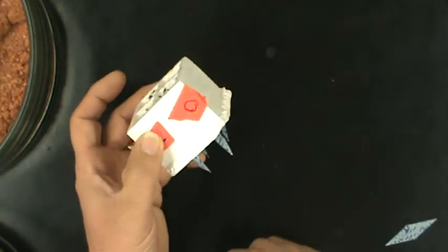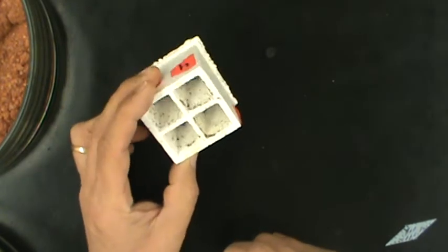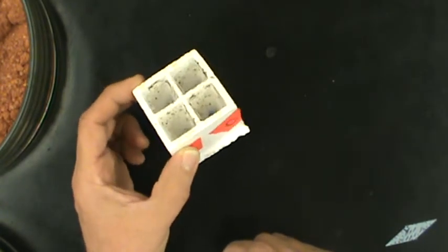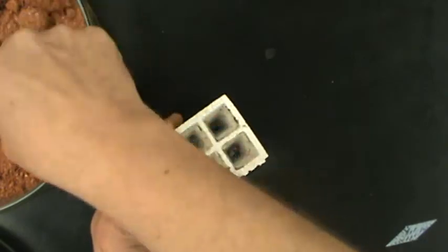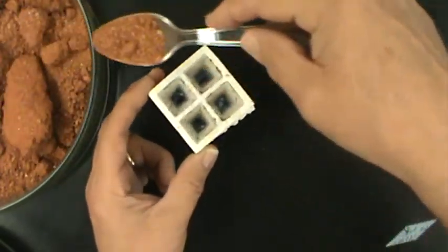When you have your wicks in place, then it's time to load the quads about three-fourths of the way full of soil. We have a variety of different soils that you can use depending on what variables your group chooses to test.